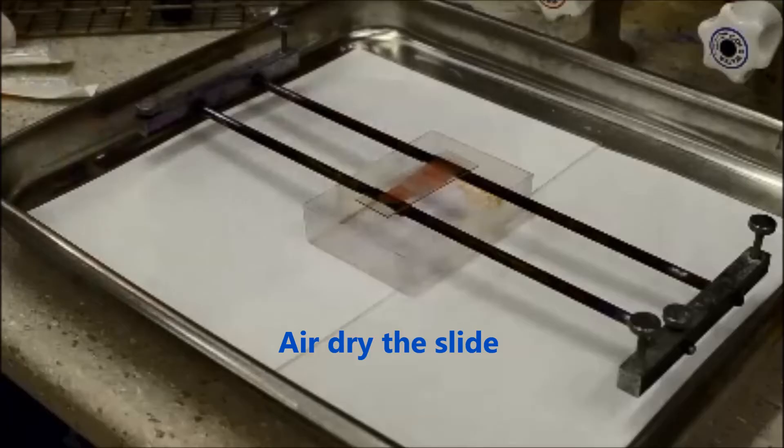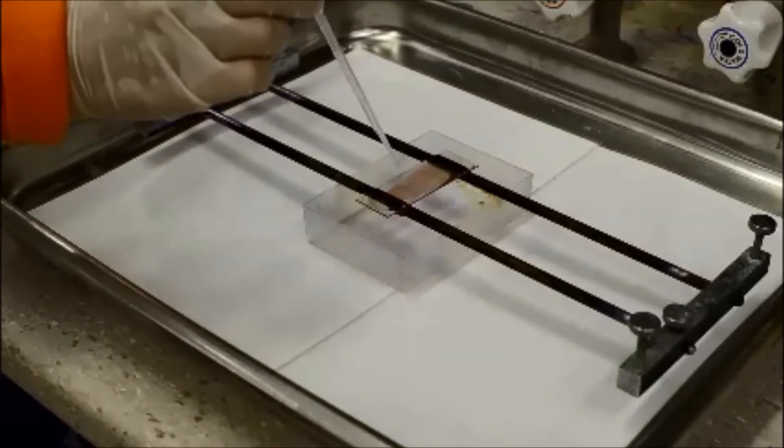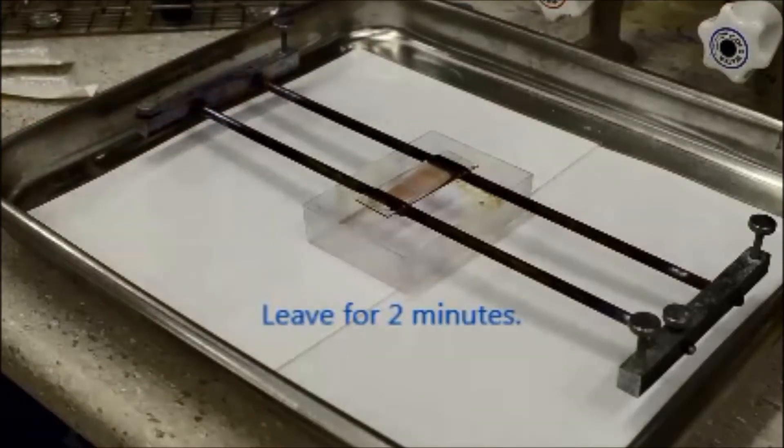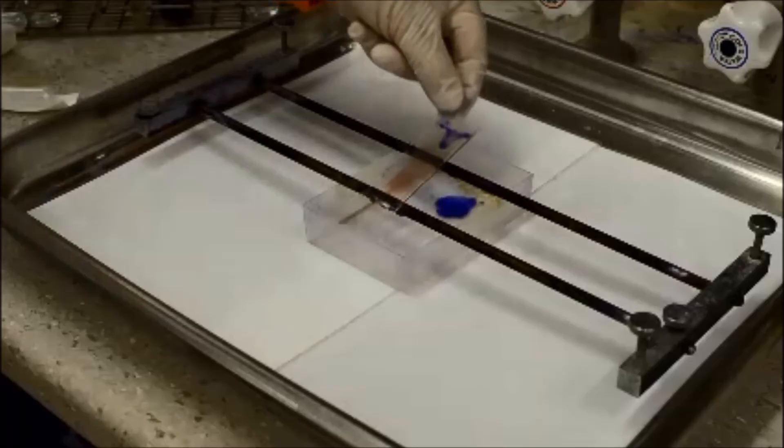Air dry the smear and when dry, fix in methanol for 2 minutes. Pour off the methanol but do not wash.